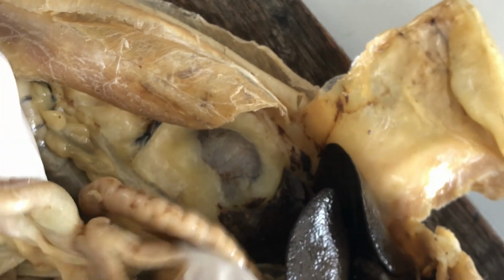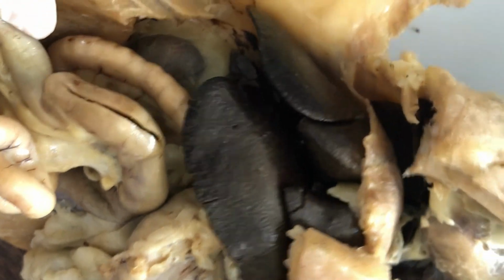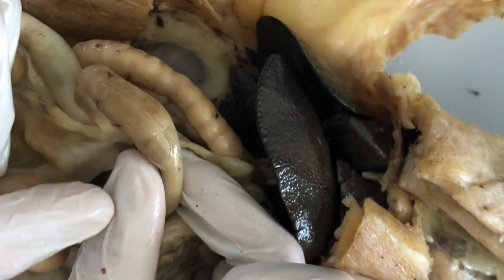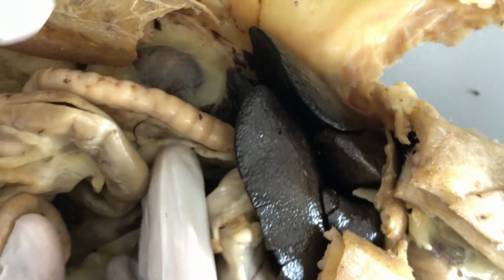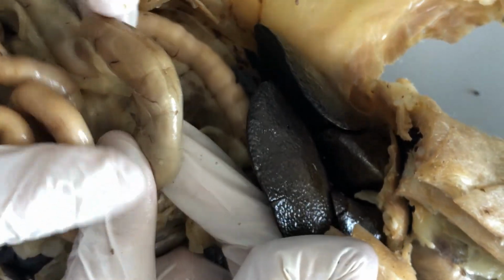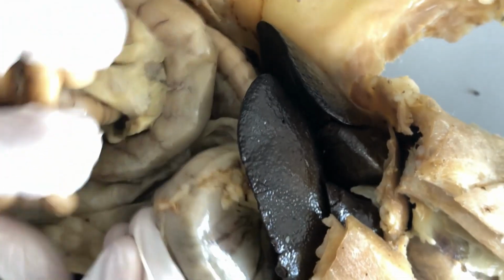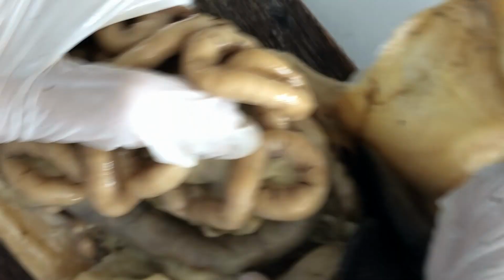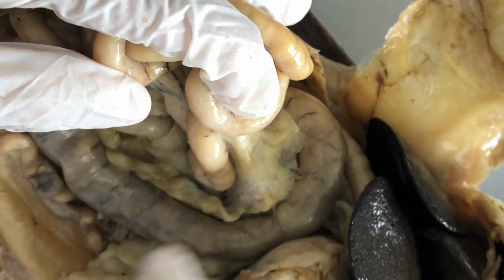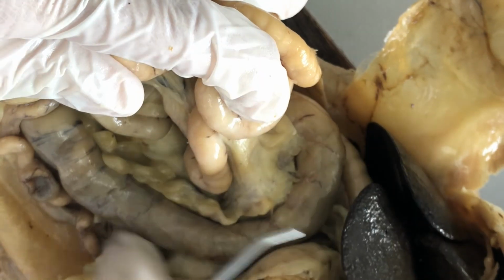Okay? And then now we reach the large intestine. By this time, most of the nutrients will have already been absorbed by the small intestine and carried into the blood circulation. And now the digestive stuff will arrive at the large intestine, for final reclamation of water. That's the main function of the colon, for reabsorption of water, because digestion is quite dehydrating. There's lots of secretions, you're losing a lot of fluids. The colon will reabsorb that water and also salts so that you don't get dehydrated.